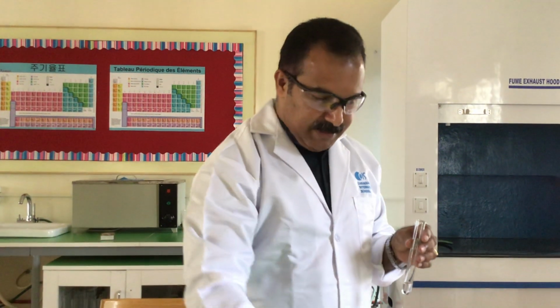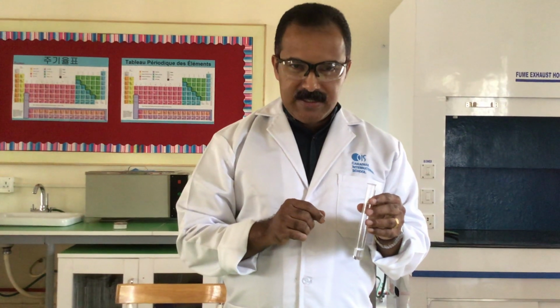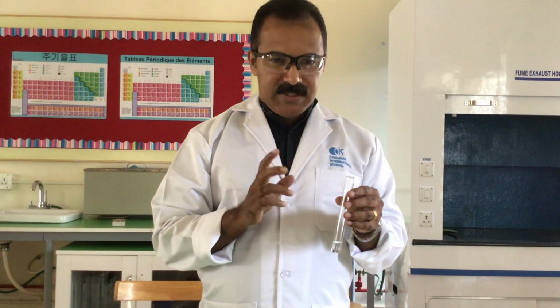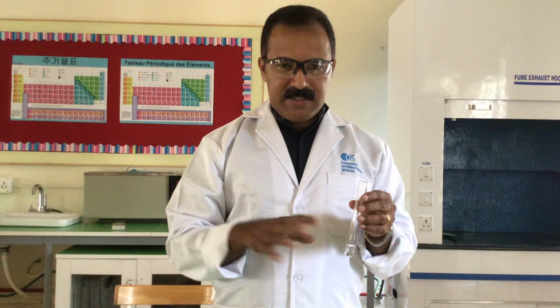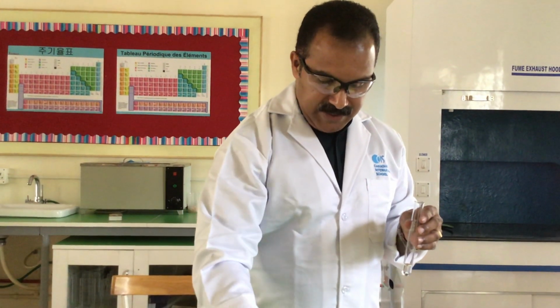When they say add barium nitrate, I should acidify. They didn't specify which acid to use for acidifying. Since the reagent is barium nitrate, we are expected to add nitric acid, not hydrochloric acid, not sulfuric acid. It should contain the common ion. So I'm using nitric acid to acidify.